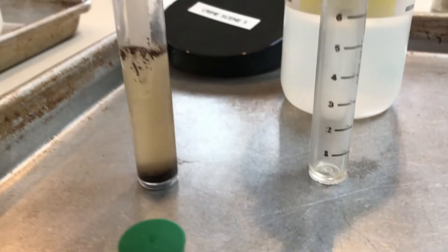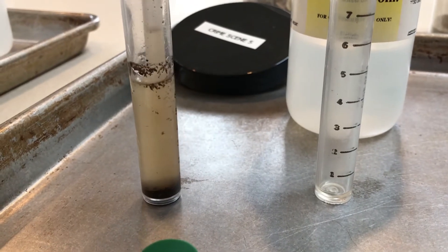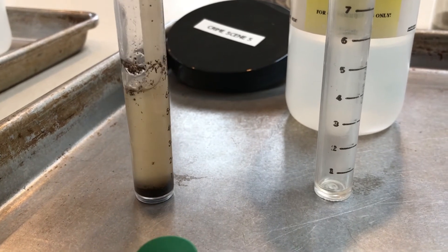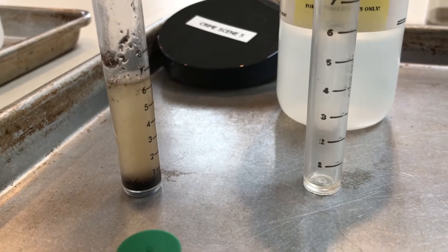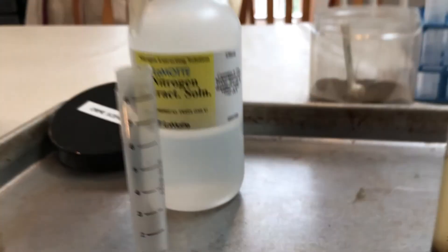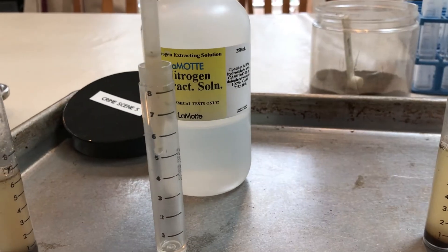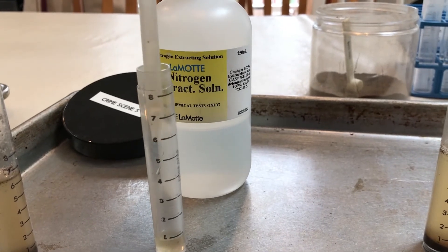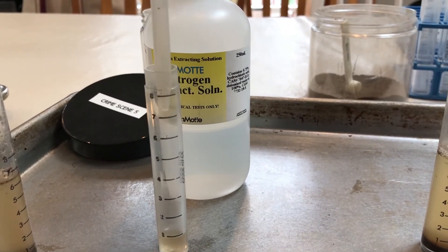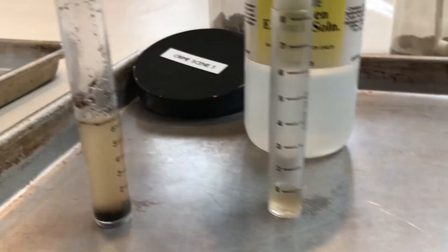You're gonna insert it slightly down into the clear layer of the water in the extraction solution, and then we place it into our new test tube like so. You want to keep doing that until it's all the way up to line three.